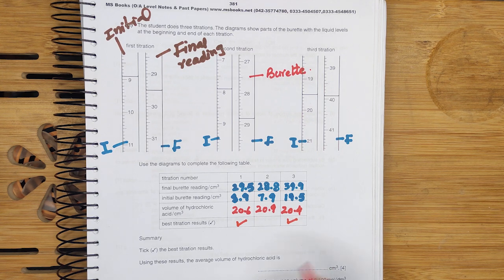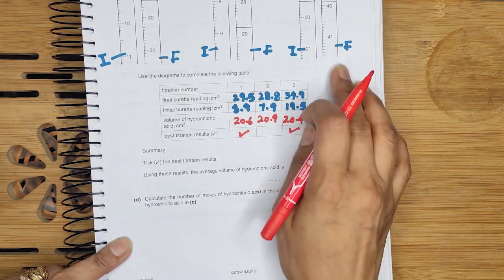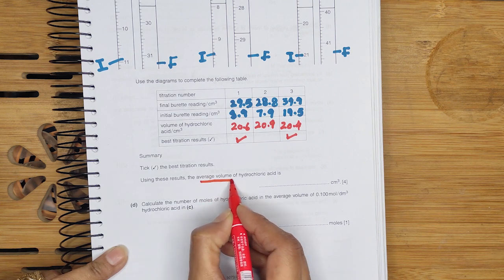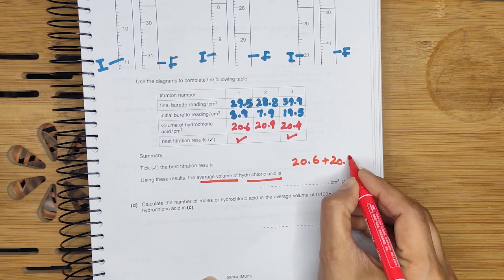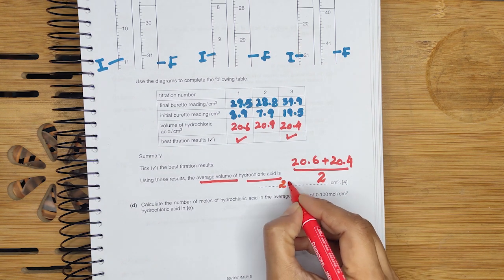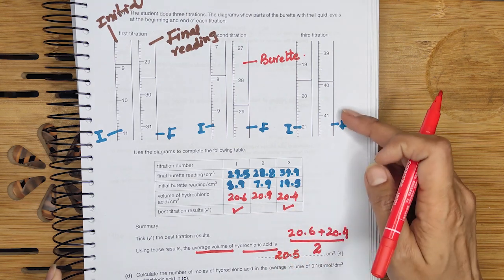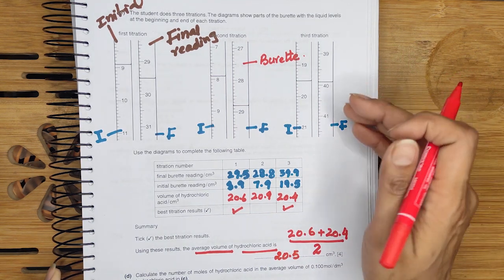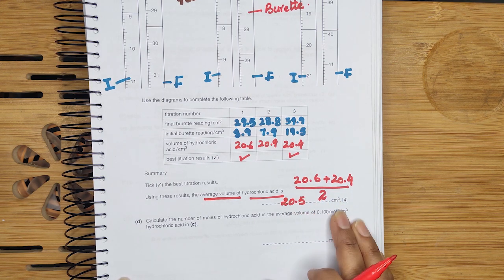How do we use these best results to get the average volume of hydrochloric acid? After recording these burette readings, we calculate the average volume. We add 20.6 plus 20.4 and divide by 2. The answer we get is 20.5 cm³. This is the way through which you have to fill the table and calculate the average volume of hydrochloric acid used.